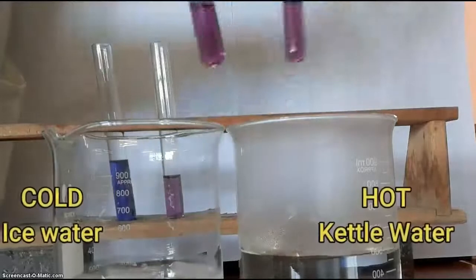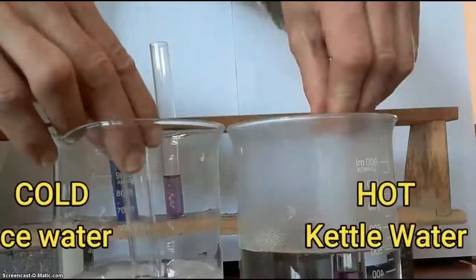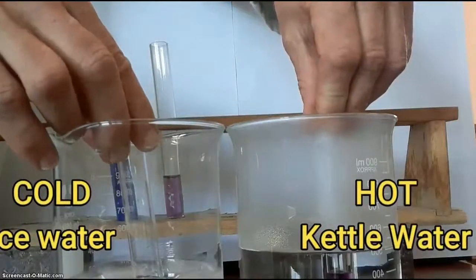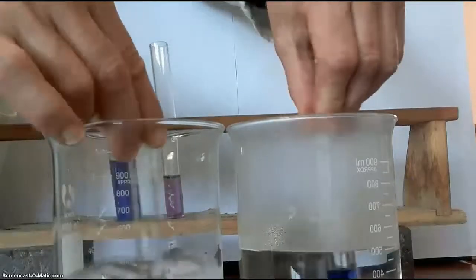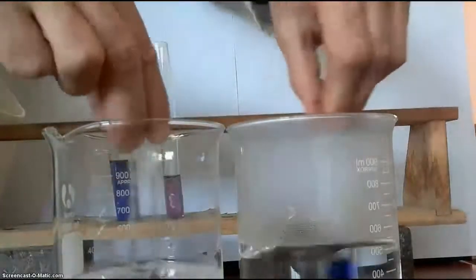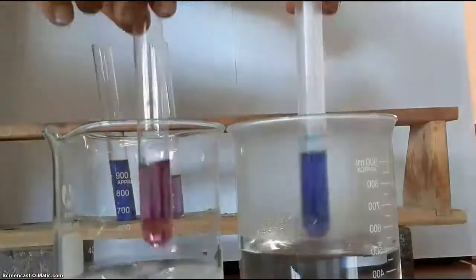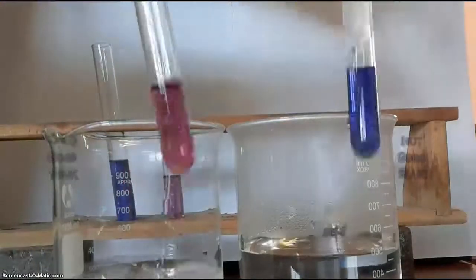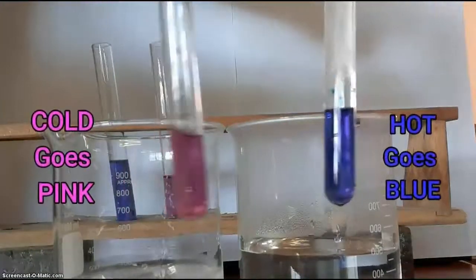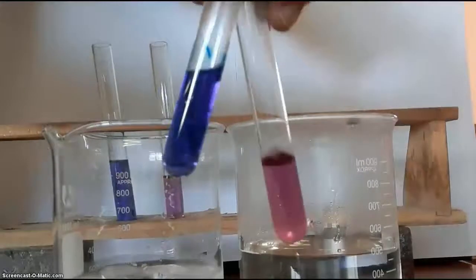We're now going to put one in hot water — kettle water — and the other in cold ice water. And very soon we can see that the cold one has gone pink and the hot one has gone blue.